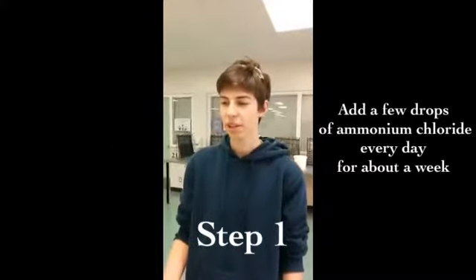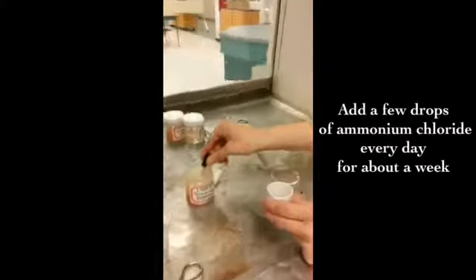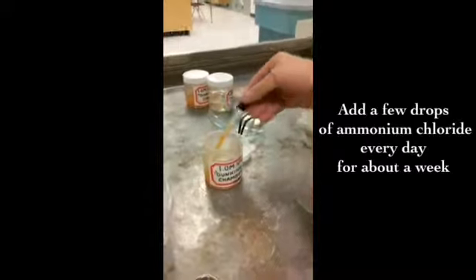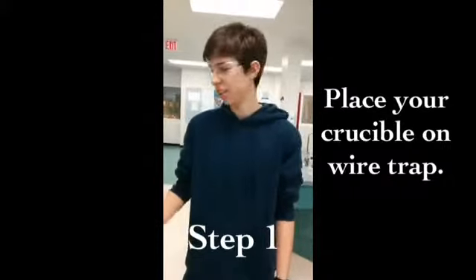Part 2. For the next few days, we're going to use the medicine dropper to drop some drops of ammonium chloride into our steel wool to keep it nice and moist. Now we're on our final day. It's time to get our crucible.